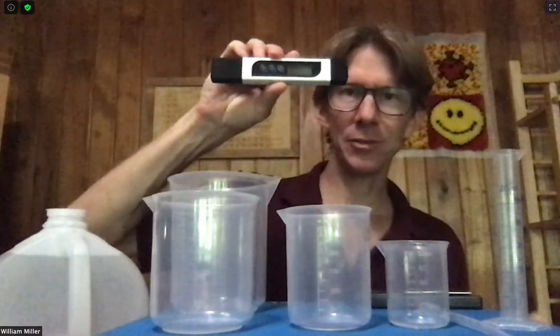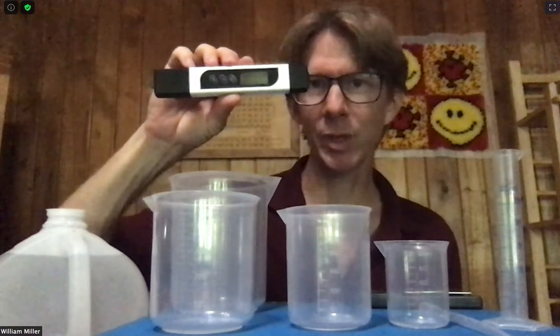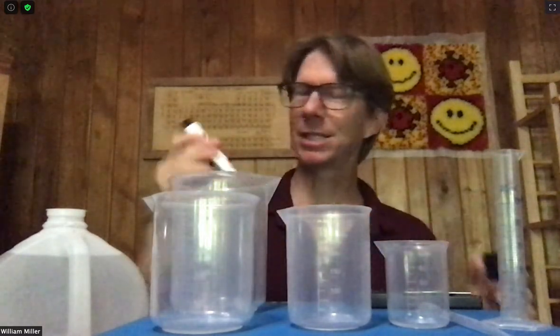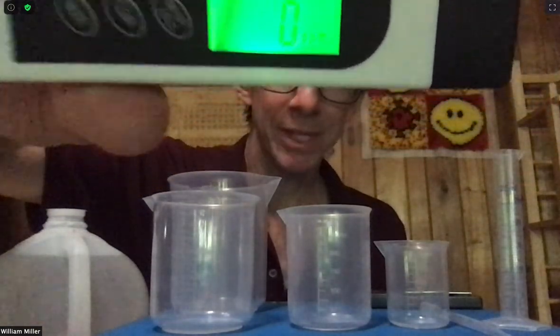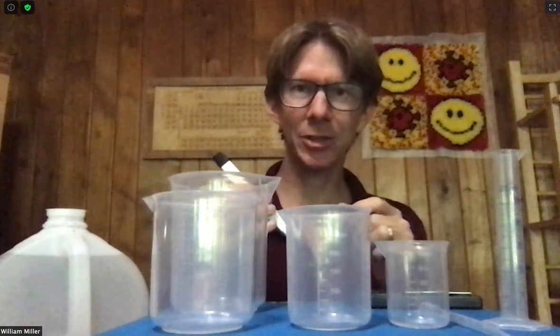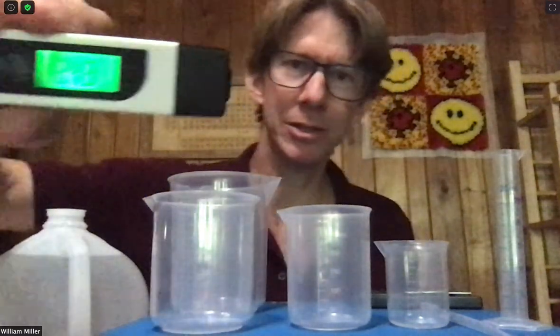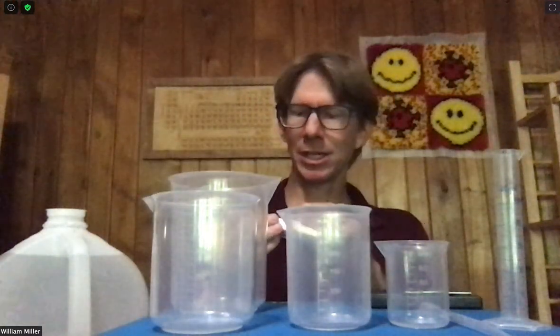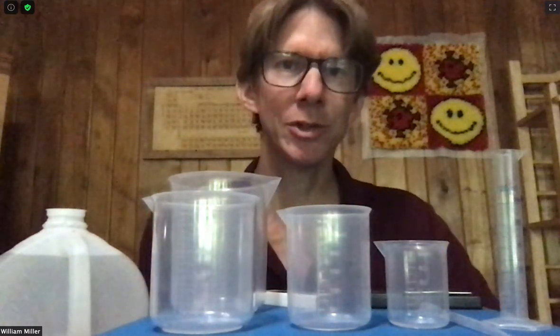Then I have a temperature probe. I bought this temperature probe in a kit with a pH probe for a total of $22.00. It does measure temperature but that's not its primary focus. It's actually a water quality tester — it reads parts per million. If you hit the mode button twice it will get to degrees Celsius — 24.3 degrees Celsius — and then it'll get to Fahrenheit as well. And those are the materials you'll need for Experiment 1 basic techniques.